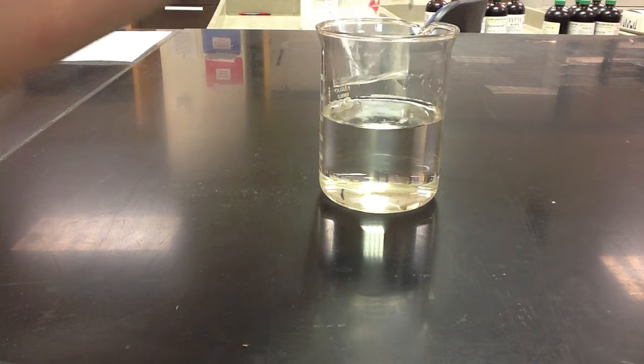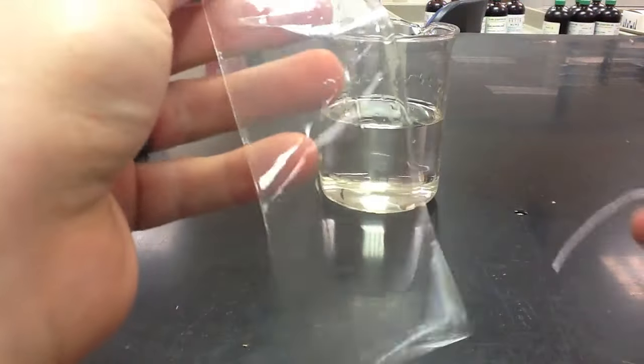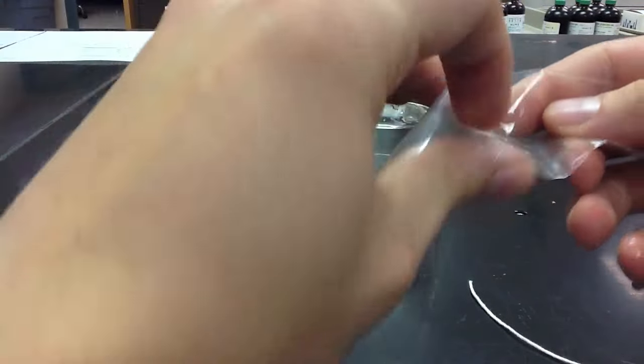I've started this experiment by first getting the dialysis tubing wet. This makes it much easier to actually pry it open so that we can place whatever liquid we need to inside of it.